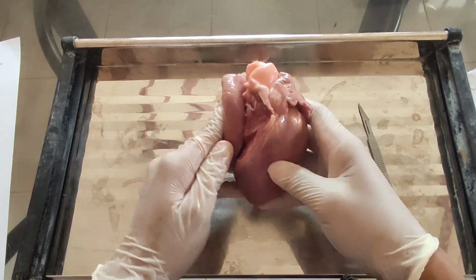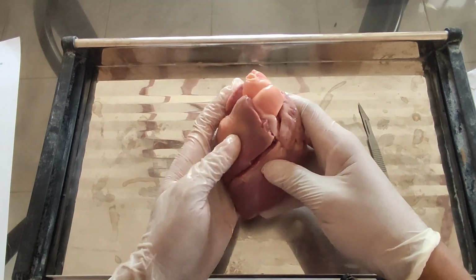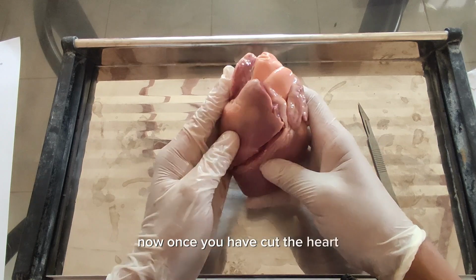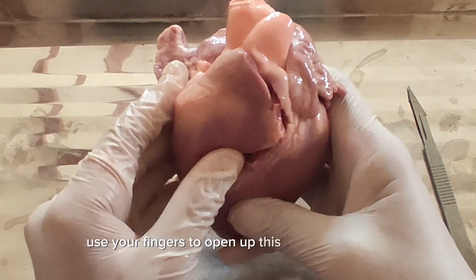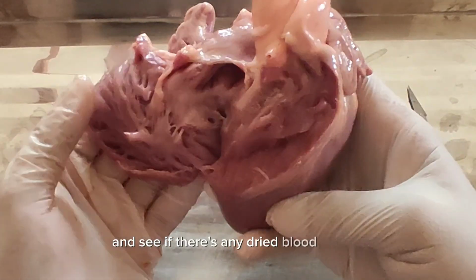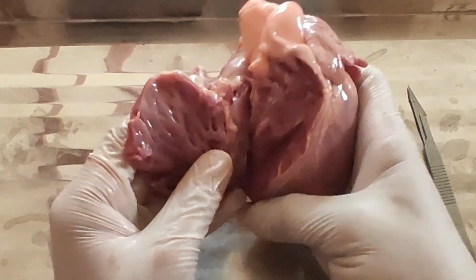Once you have cut the heart on the side of the pulmonary artery, use your fingers to open up this internal structure and see if there's any dried blood. Wash it and rinse out the heart.